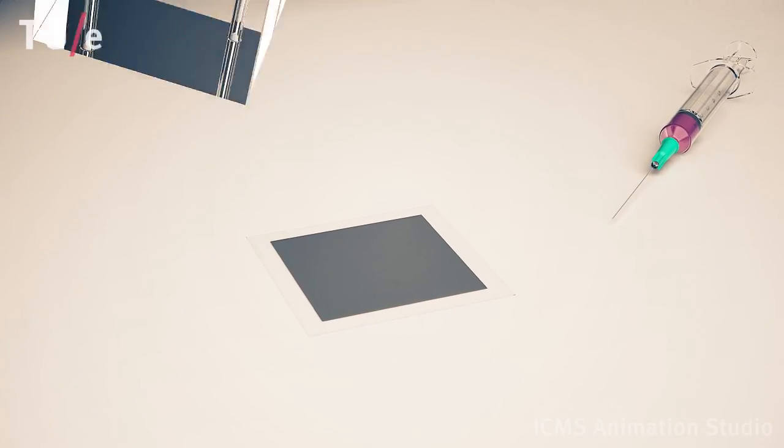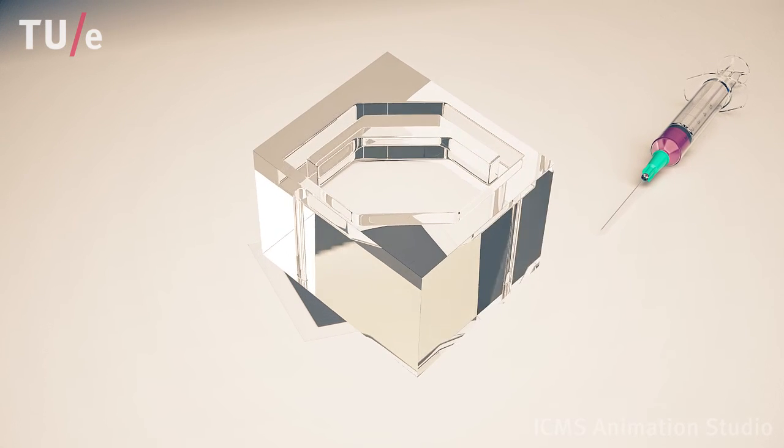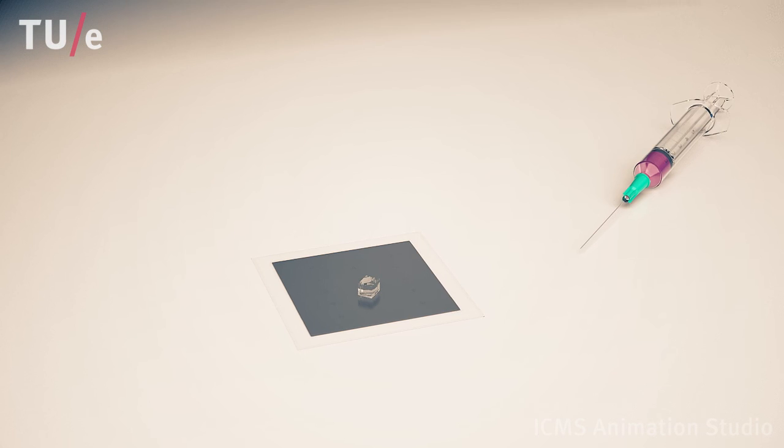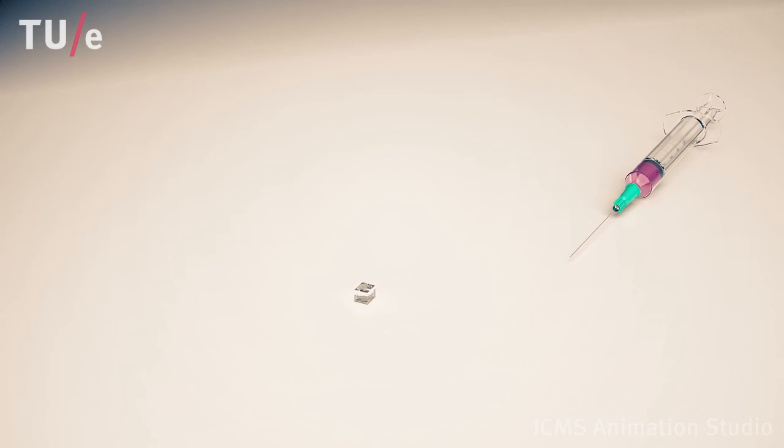A pre-made microfluidic device is attached on top of the artificial cilia substrate, resulting in a channel with the artificial cilia covering its floor.